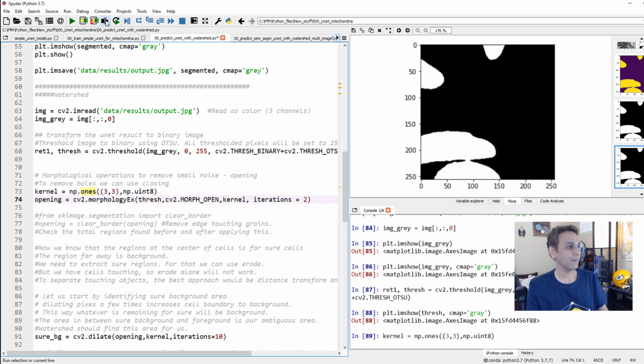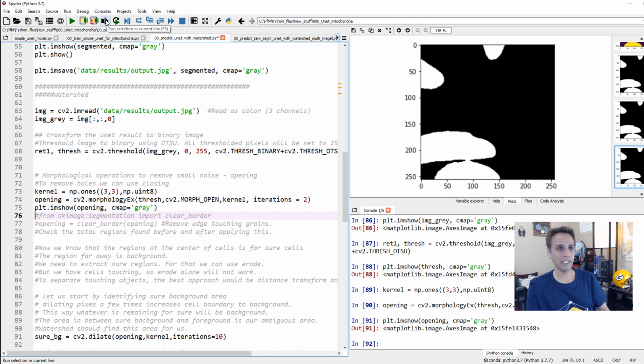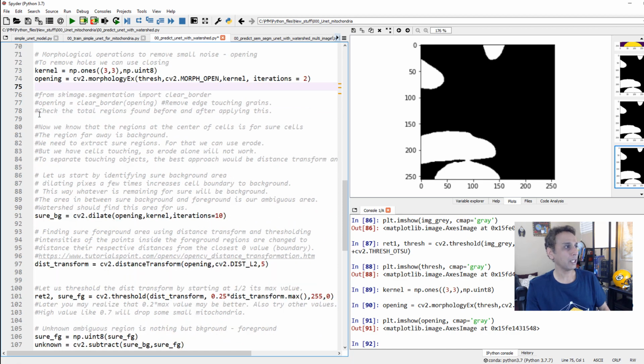Every time you do any of these, have a quick look at it. Let's do the same to see if it makes any difference. You see, slightly, not much difference in this case. Now, I commented out a few other steps right here, and a lot of notes, and I commented a couple of steps like clear border, for example. Clear border removes all the objects that touch the border. In this case, if I do that, I would end up with nothing.